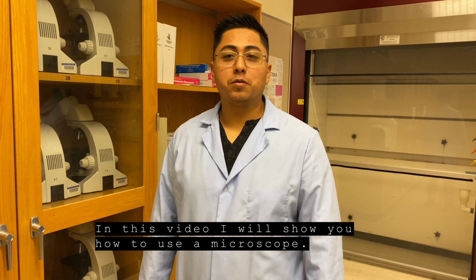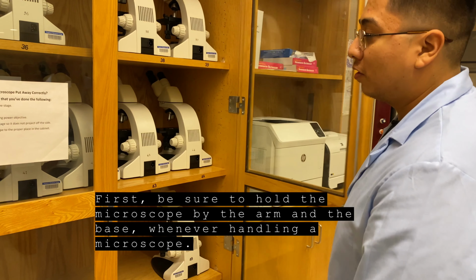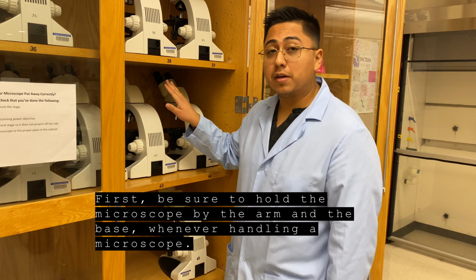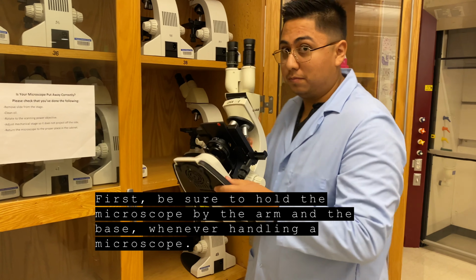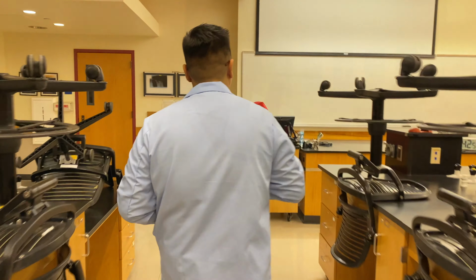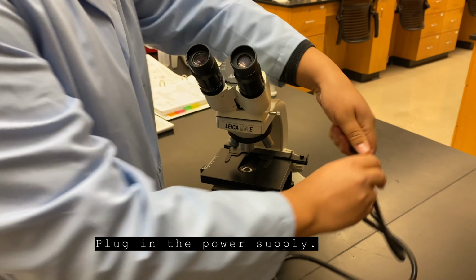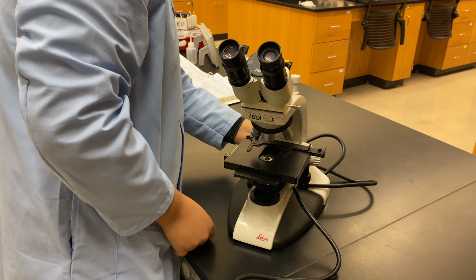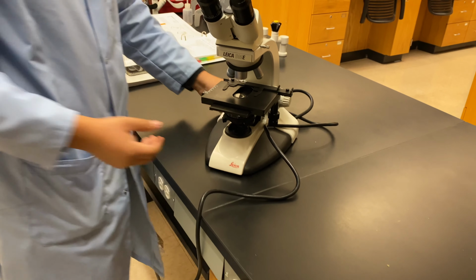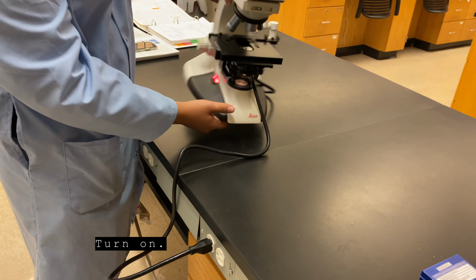In this video, I will show you how to use a microscope. First, be sure to hold the microscope by the arm and the base whenever handling a microscope. Plug in your power supply. Turn on.